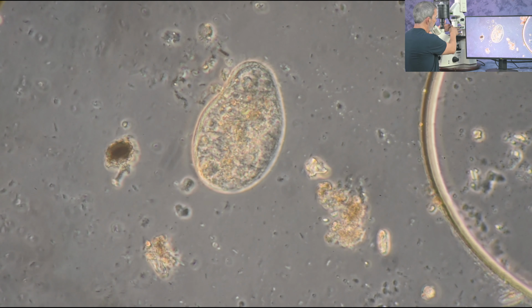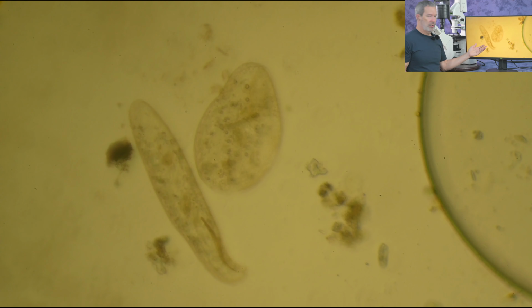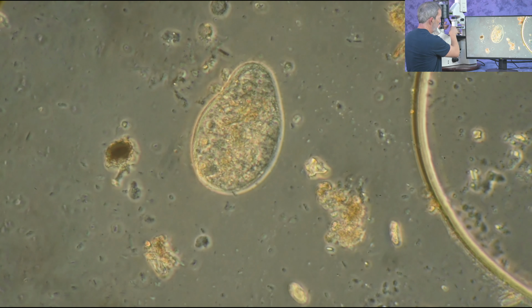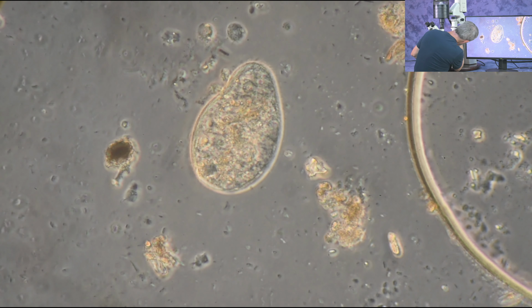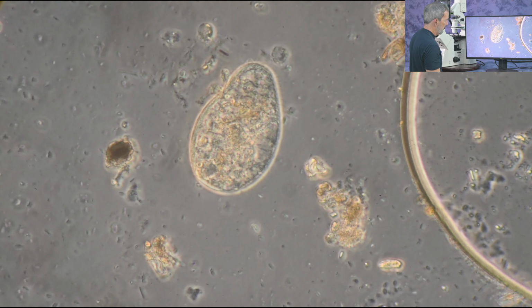Okay, so that's the phase contrast. Let's go over to the bright field. On the bright field, 40X LD Acroplan, I'm pretty washed out, not seeing any contrast, not really seeing what's going on. Phase 2 setting on the condenser, matching the phase 2 ring in the back aperture of the objective, gives me a phase image.